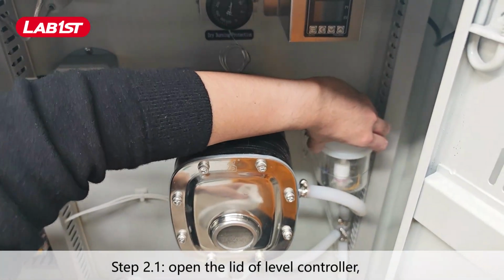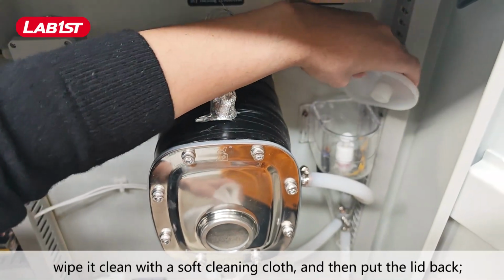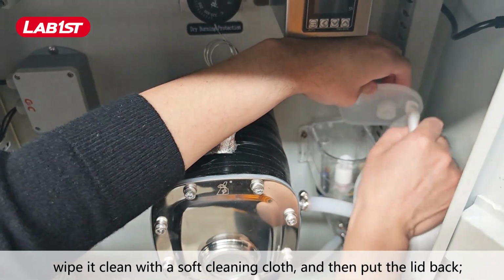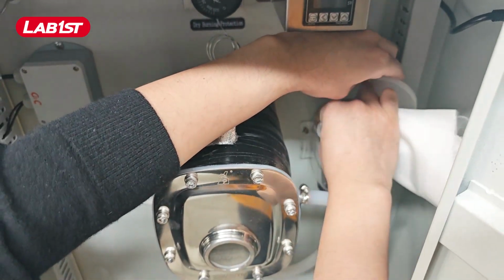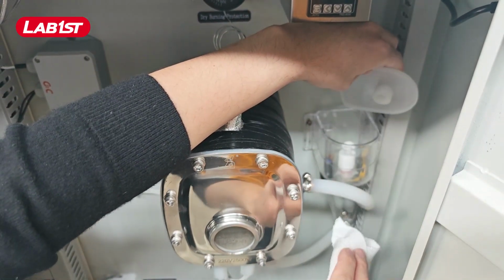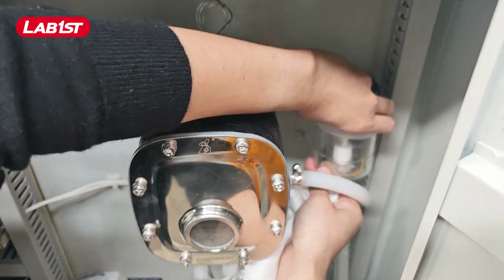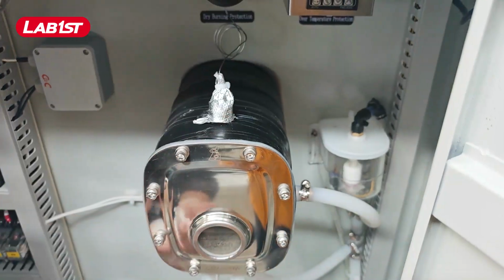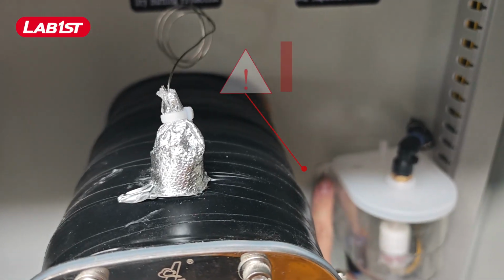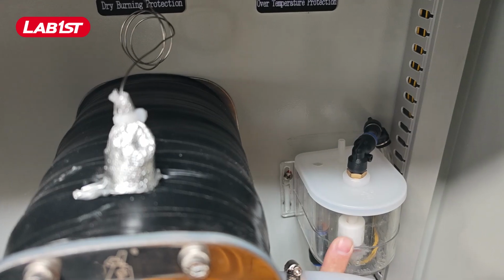Step 2.1. Open the lid of level controller, wipe it clean with a soft cleaning cloth, and then put the lid back. Attention, do not remove the level controller body, that might change water level in humidifier.